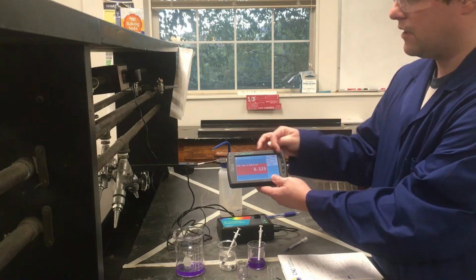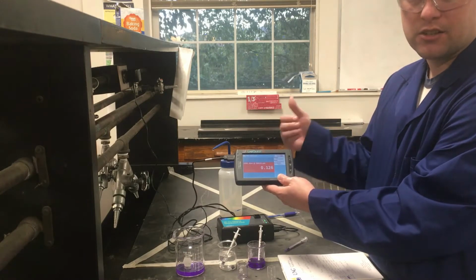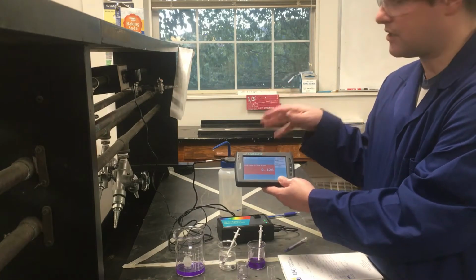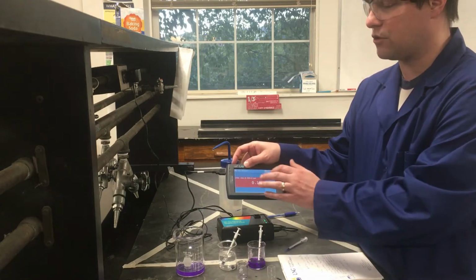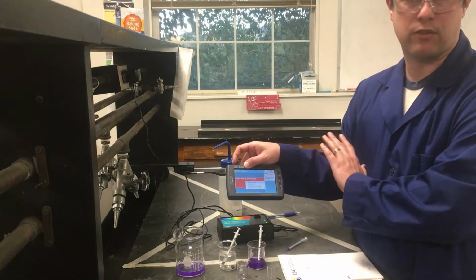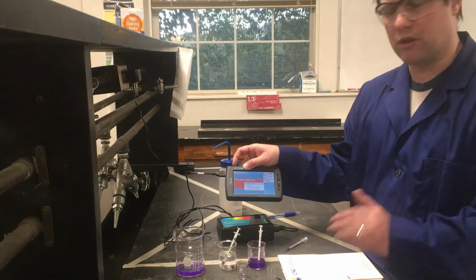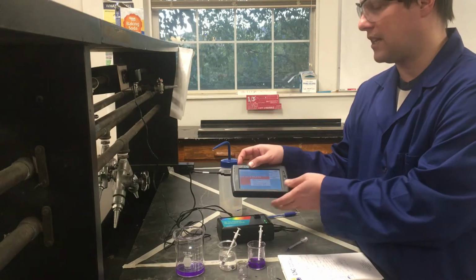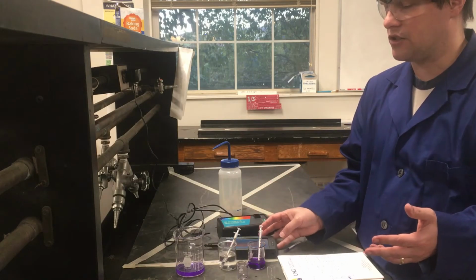What I did to do that, in this upper right-hand corner, I changed it from full spectrum to time-based. So instead of seeing that plot with some of the colors on it before, now it's just telling me what the absorbance is. And when I hit this little red box, I get an option to change the wavelength. I just set the wavelength to whatever my lambda max was from the first part of the experiment. So I'm using those results from part 1 to help set up for part 2. And now I'm just going to be measuring the absorbance of some different concentrations.